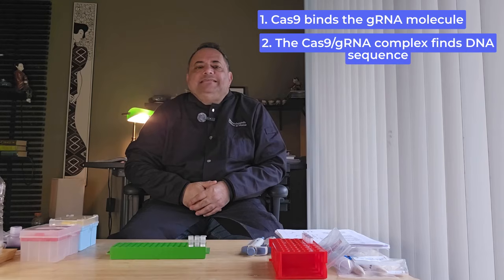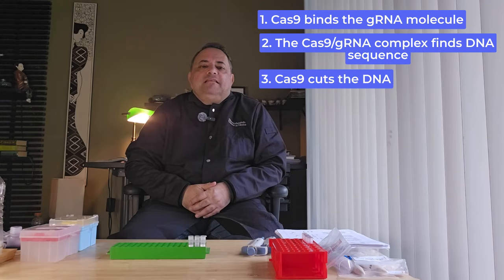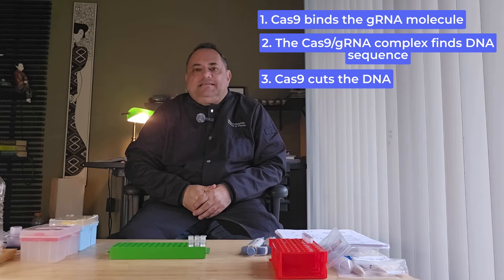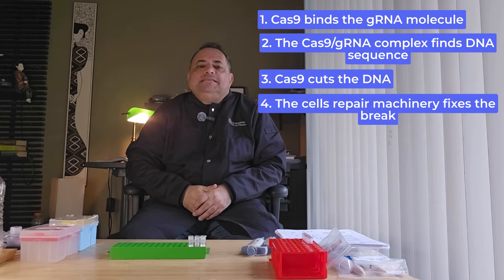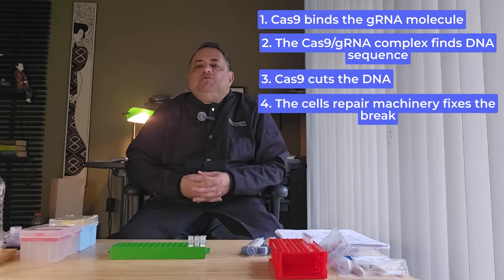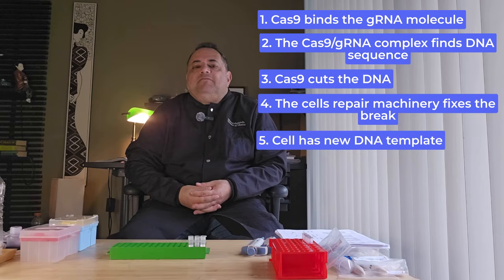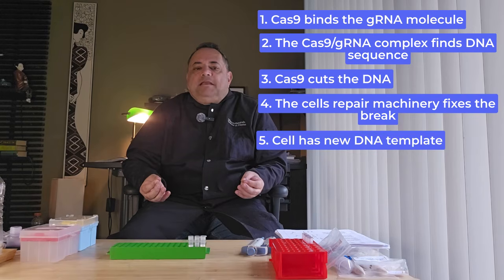Second, the Cas9 guide RNA complex finds the DNA sequence that matches the guide RNA. Step 3, the Cas9 cuts the DNA. Step 4, the cell's repair machinery fixes the break using the supplied DNA template. And step 5, the cell has new DNA template.